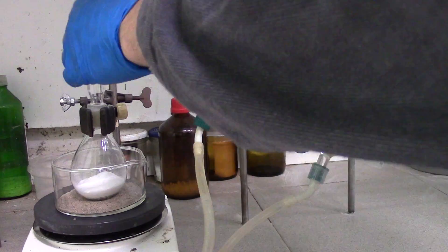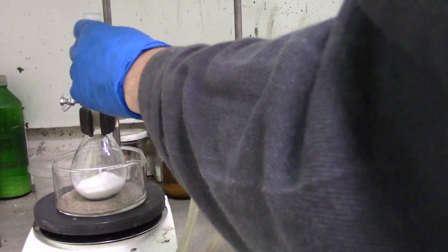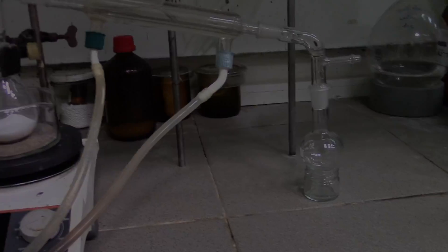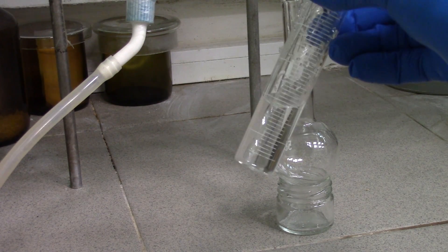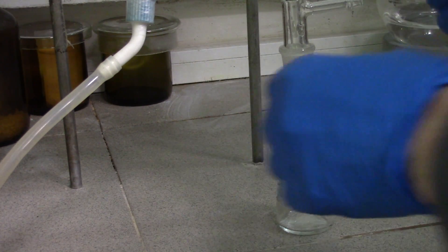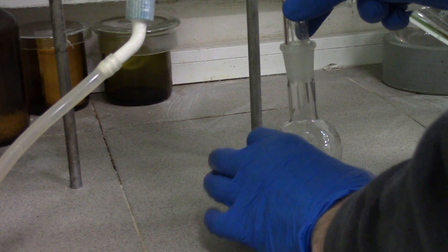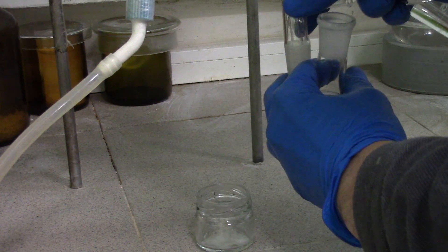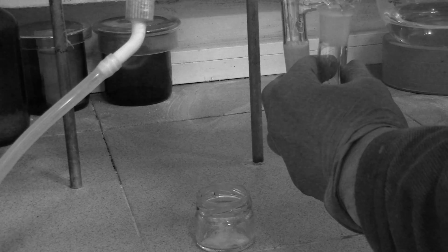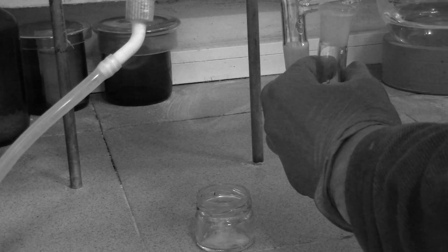Now construct a simple distillation setup. I have poured around 10ml of distilled water into a receiver vessel, due to legal regulation in my country. But if you need a highly concentrated acid, just ignore that step.